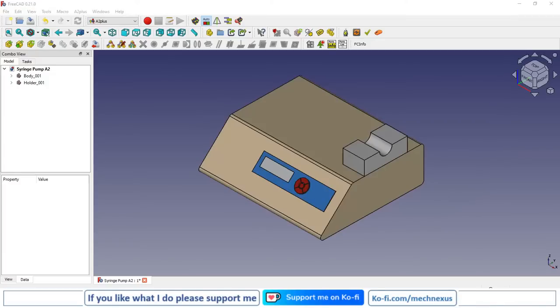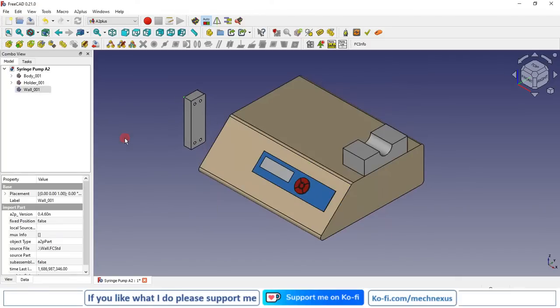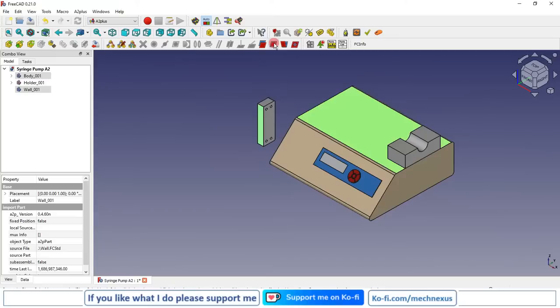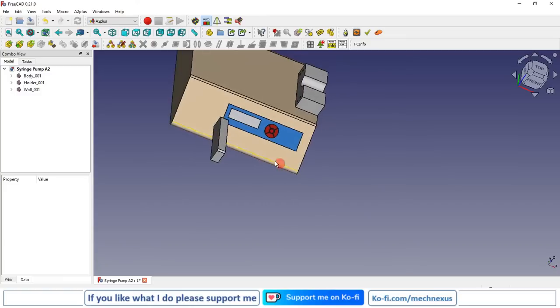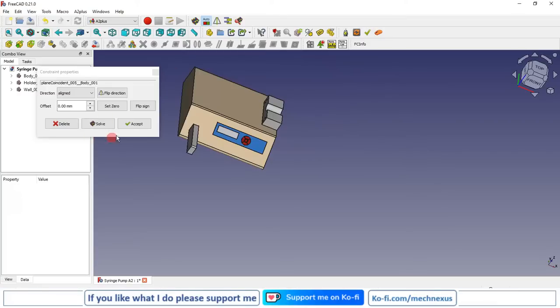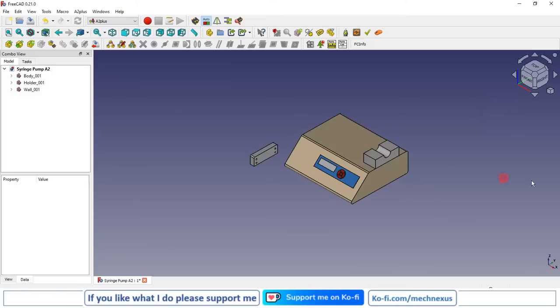Now the next part we are going to constrain is a wall. So I will click on add part, and from my folder I will select wall. Now I will select this face and top face of my body and place coincidence constraint. Now I rotate my model. I will select this face and again place coincidence constraint. Now it has the 1 degree of freedom in y direction.